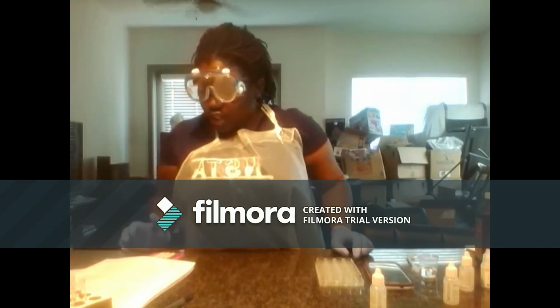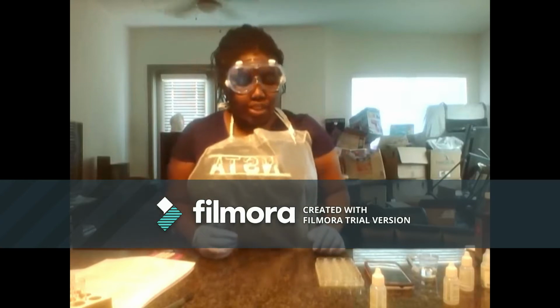In trial 4, they're the same, so I'm going to do it once on camera and then I'll repeat the experiment and record my times.